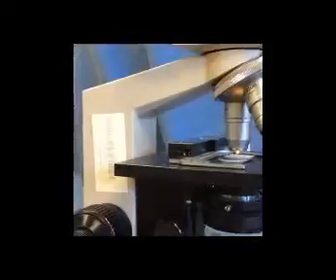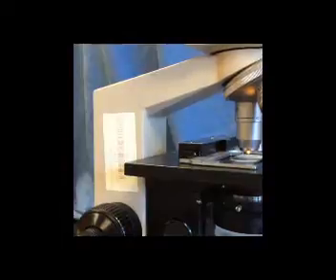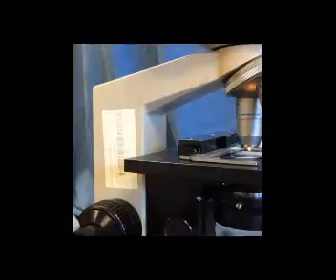Now the question is, which focus adjustment knob can we use with a high dry lens? And you'll recall we can only use the fine focus adjustment, this innermost one, and it should only take half a turn, one, maximum 2 turns to bring your specimen into focus. If it takes more than 2 turns of fine focus to get the specimen into focus using high dry or oil immersion lens, make sure to call one of the instructors over, one of our great micro tutors, because it's possible something's wrong with the microscope.